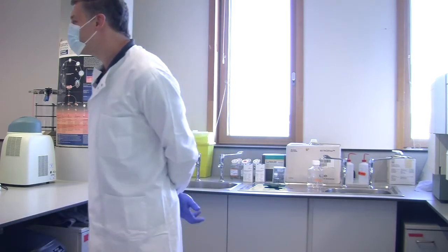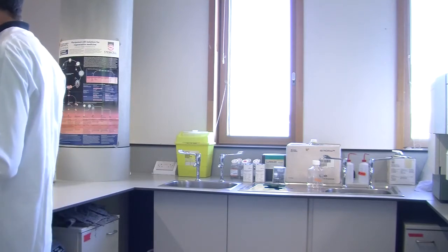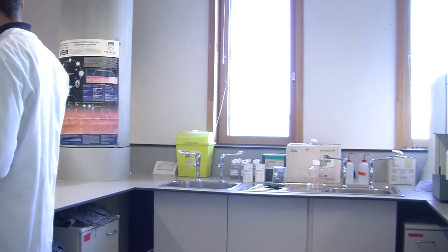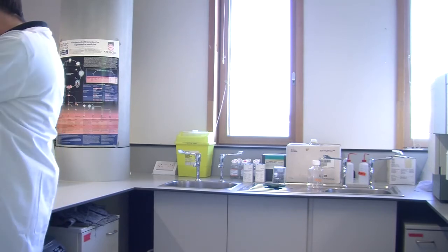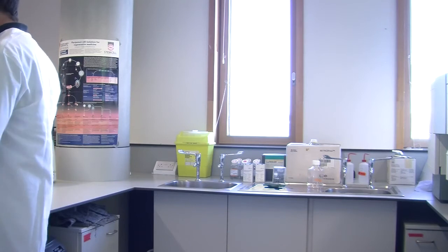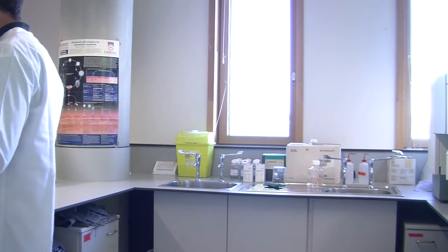It's always quite stressful, this stage, because when you're doing a research experiment and you've got these really rare, critical cells, you've only got one lot of them, and you're removing the supernatant, and you're thinking, if I go too far, I get no data whatsoever, and the whole of this project is ruined.